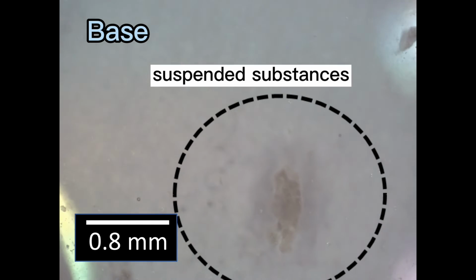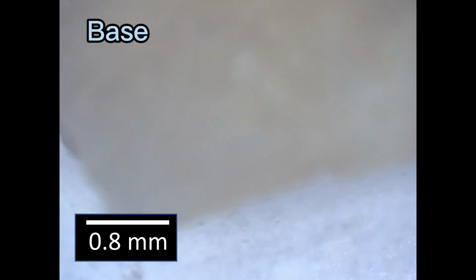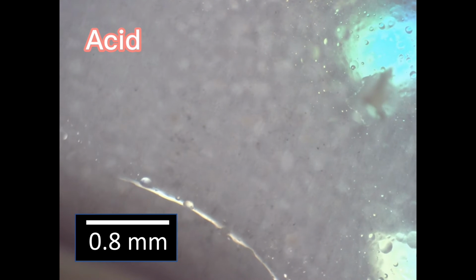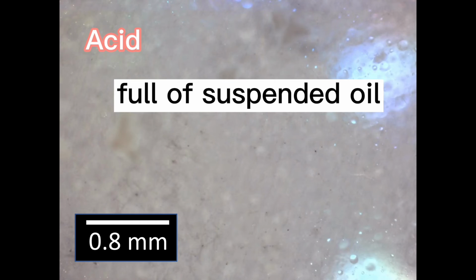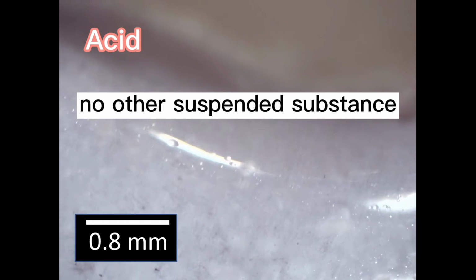In the base solution, a few suspended substances were also observed, but there were significantly more oil bubbles and starch powders. Finally, we observed the acid solution with the microscope. It was full of suspended oil, and there was no other suspended substance.